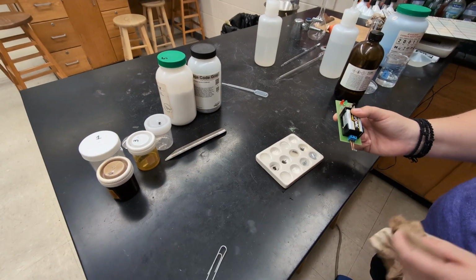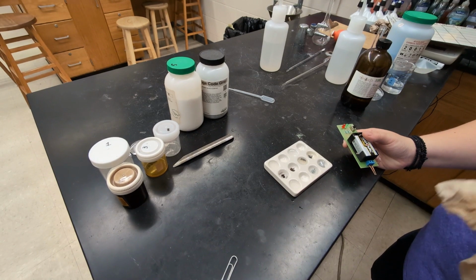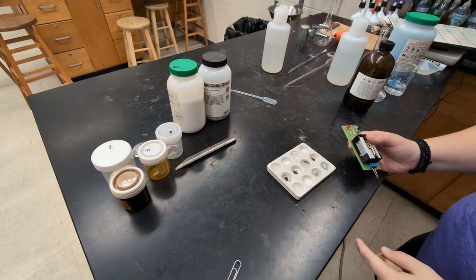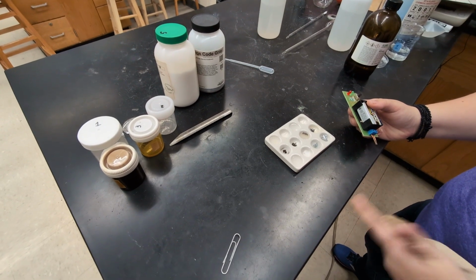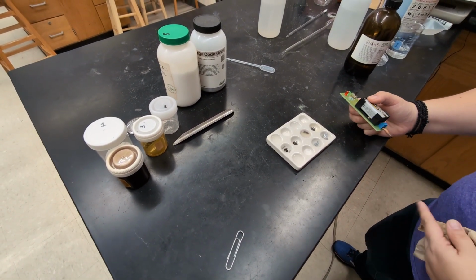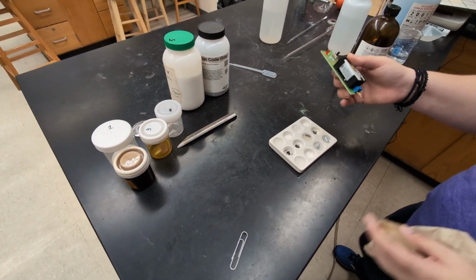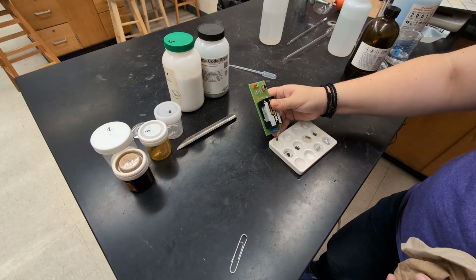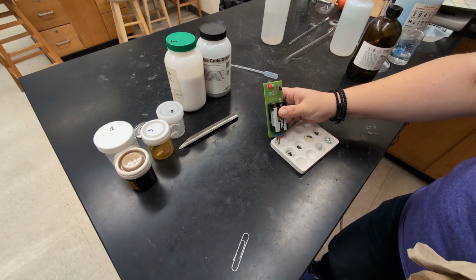Our next test is we're going to see if the substances conduct electricity when they're dissolved in water. Now this really is only useful for the substances that do dissolve in water. The ones that don't dissolve definitely aren't going to conduct in water anyway. So I'm going to test the 2 substances that did dissolve in the water, which is this one. And you see that very faint light?